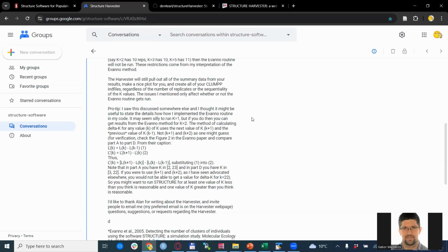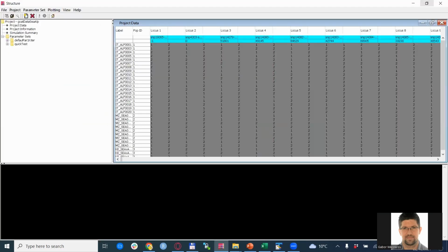So before we go to the structure harvester itself, or the Python script anyway, we run the structure itself. Here I have already loaded the data set of the goat data of the small East African and the Alpine goats and crossbred, as it was analyzed in the previous video that showed the general use of the structure software. If you are just starting now and you don't know how to load the data and what details you need to consider, I would suggest pausing this video and looking at the structure introductory video first, so you can get to this stage.